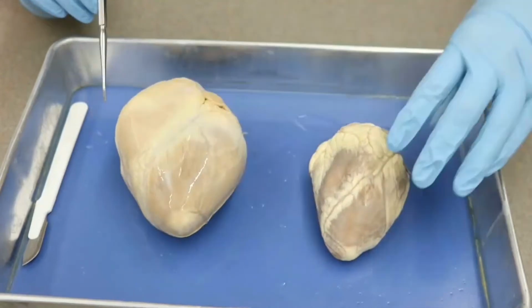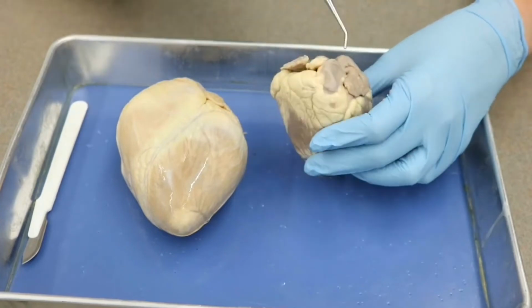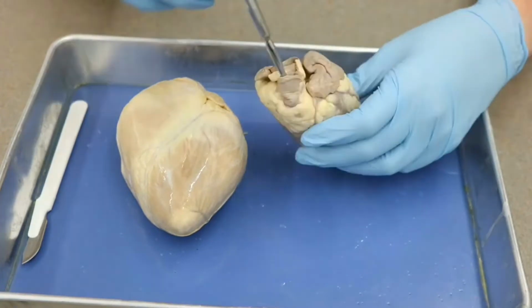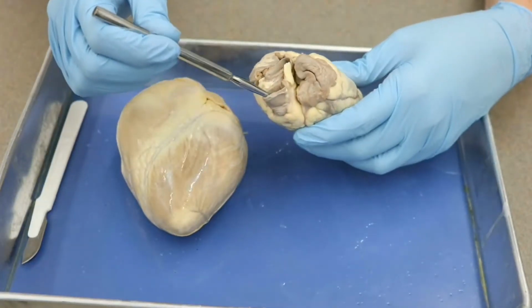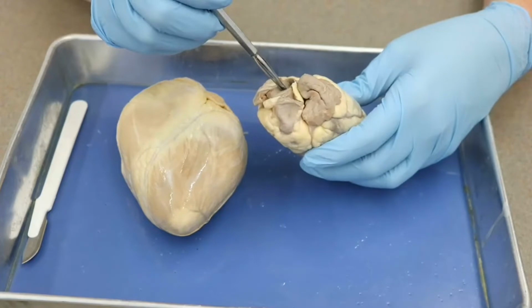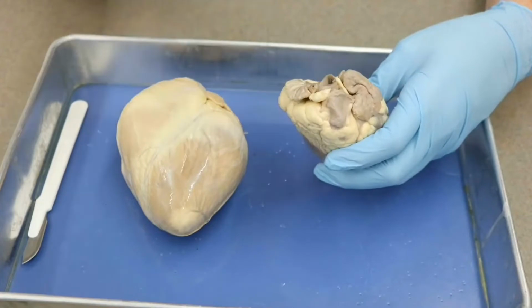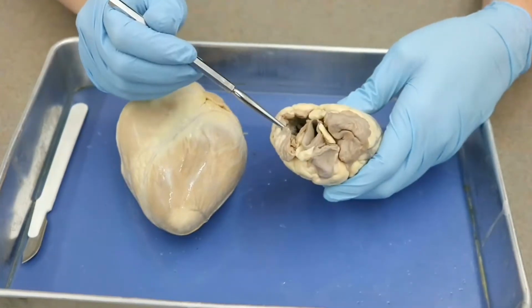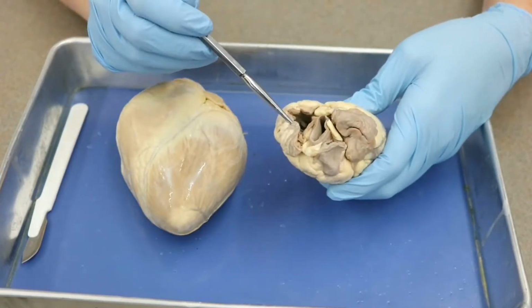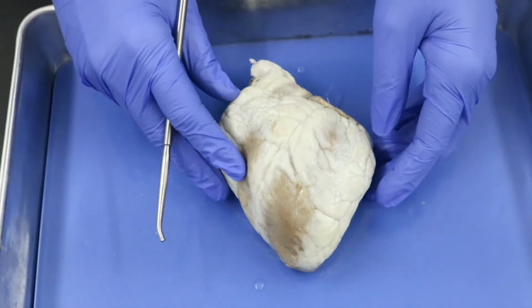But let's just go ahead and finish up by looking at those same great vessels on our sheep heart. As we're looking, we have the most anterior vessel that is coming off the right heart, and so that makes this our pulmonary trunk. Then just posterior to that, we have another vessel here, which is going to be your ascending aorta. Again, it's been cut off before we can get to the aortic arch. And this one has been cut so low that we've actually lost the vena cava. It is opening up directly into the right atrium. Okay?